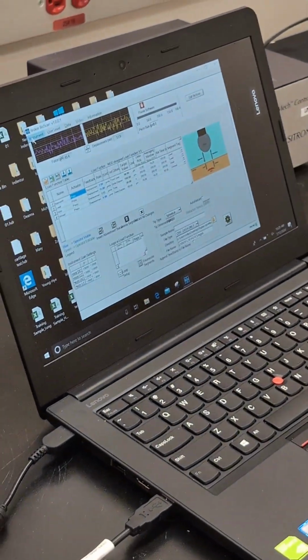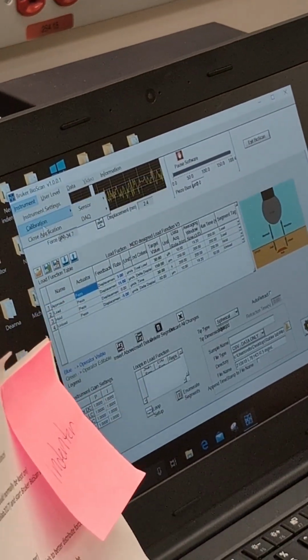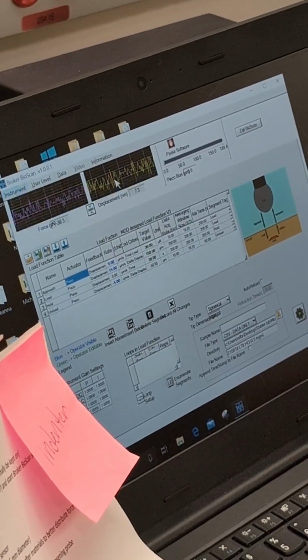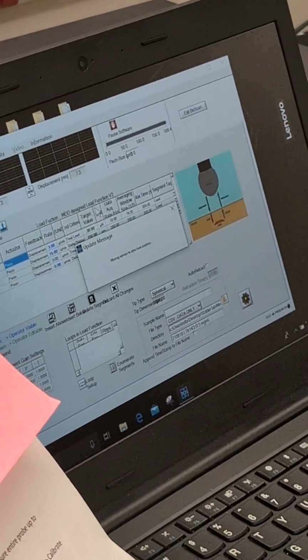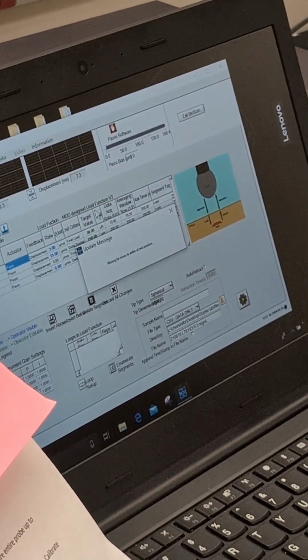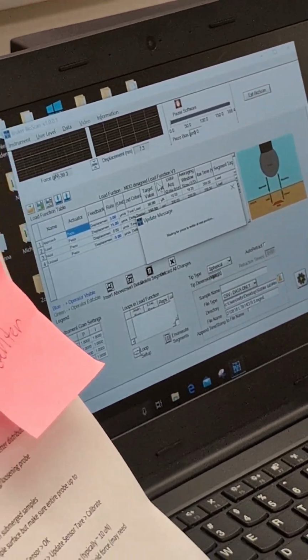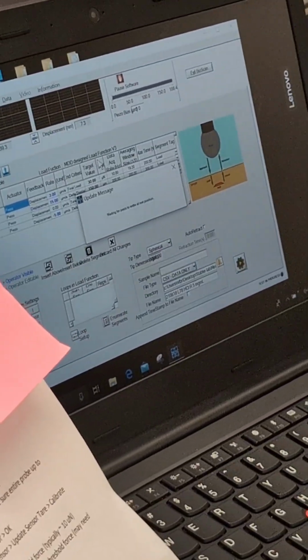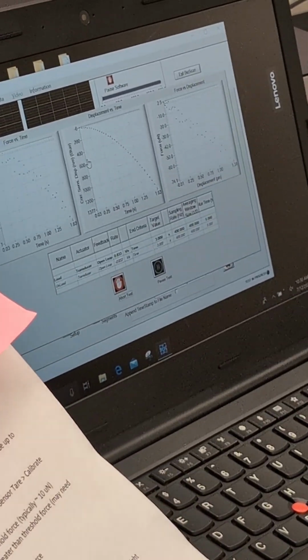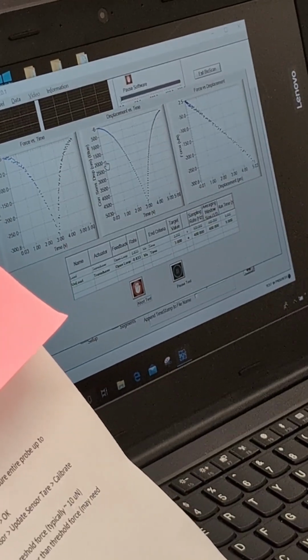So before that, let's just have a little calibration. You can generally just go with calibration and go to calibrate sensor. Okay. Just let it run as a program. It's slow. So basically it resets everything. I'm not 100% sure what the internal mechanism is, but it will just do this going down, going back.